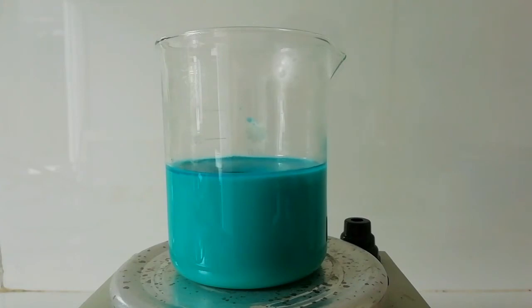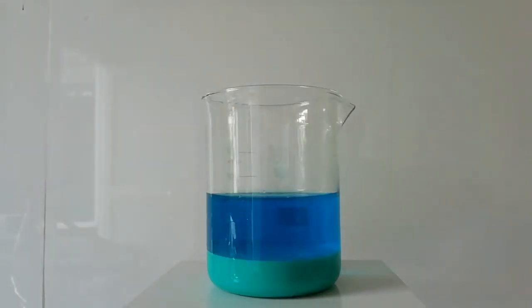Now I'm going to stop heating and let the solution cool down to room temperature. The temperature has reached room temperature, and now you can clearly see the copper citrate green precipitate and unreacted copper chloride.